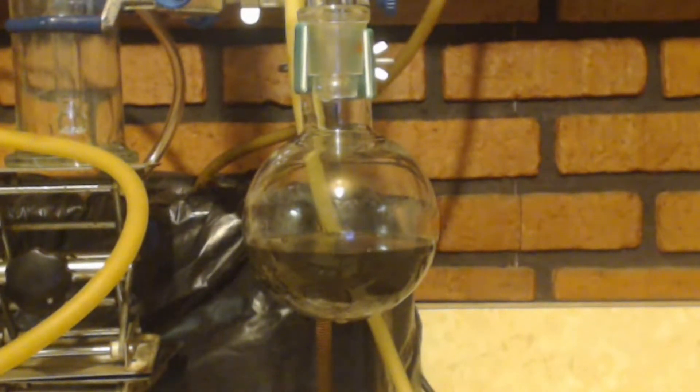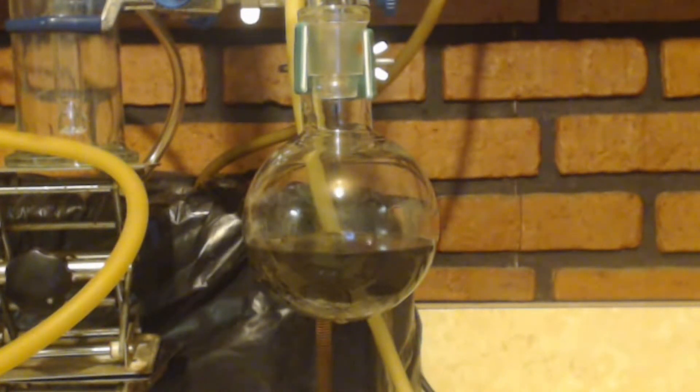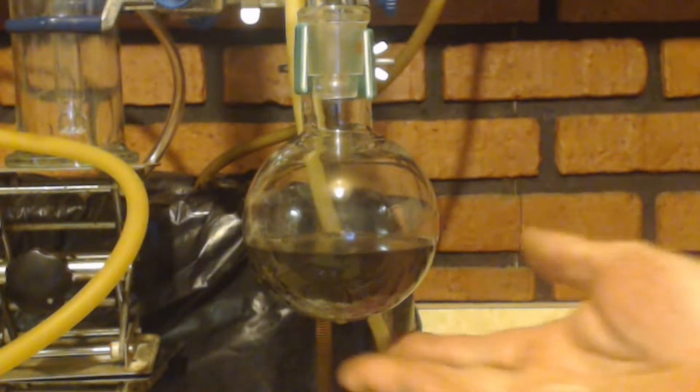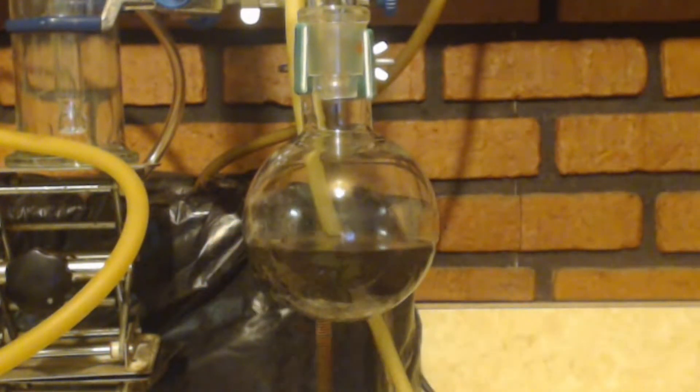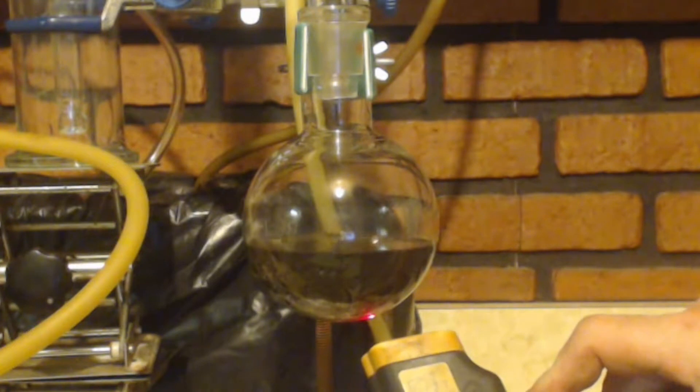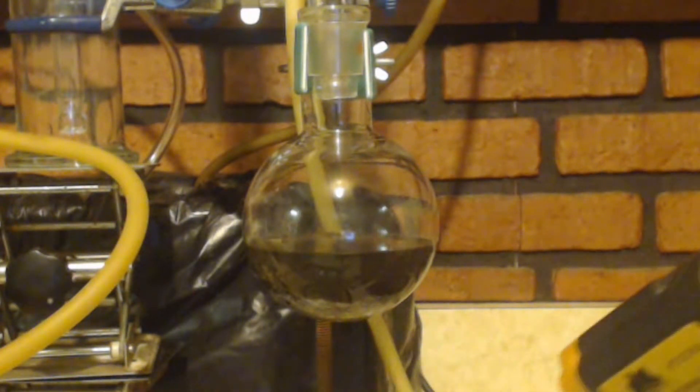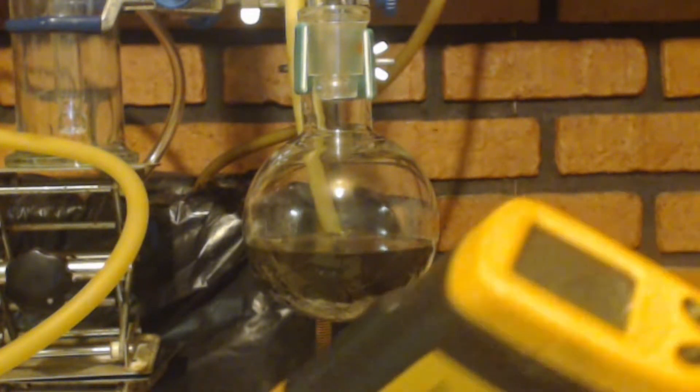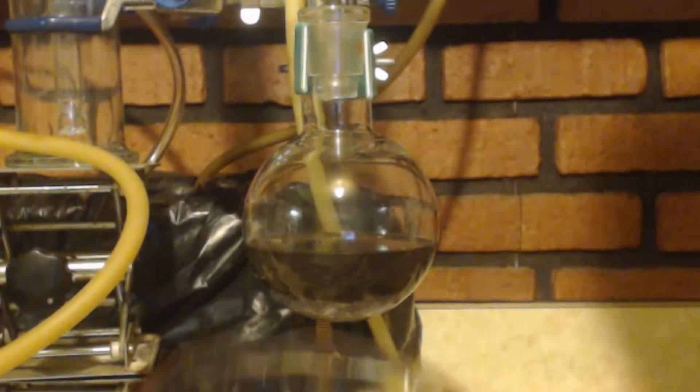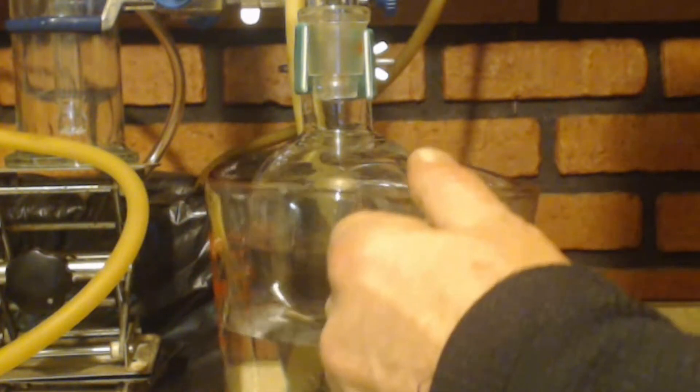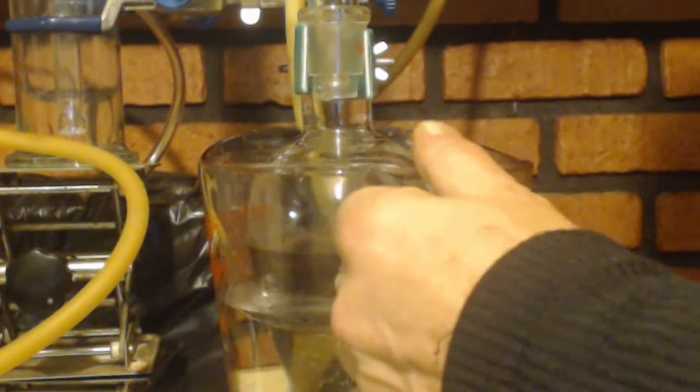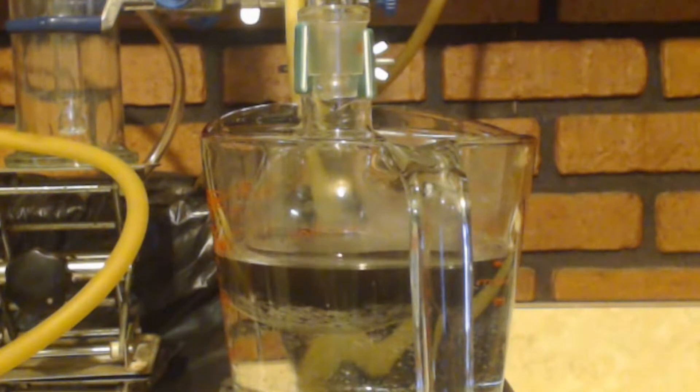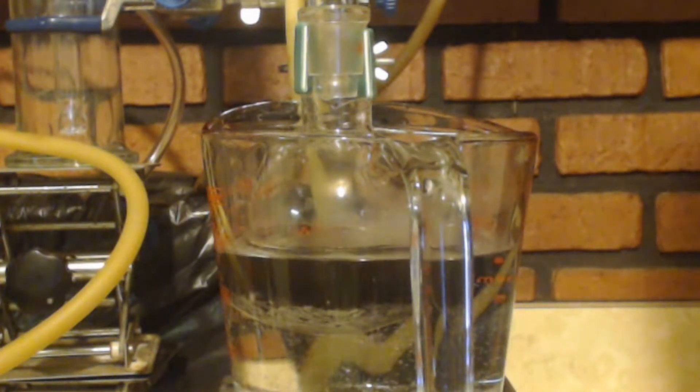Well I added everything, it's probably done. Jeez, I mean hour and a half, two hours almost. It's not boiling, but it is at 34.7. I'm just going to keep adding this hot water, maybe reflux another half hour or something. I don't think it's gone to completion.